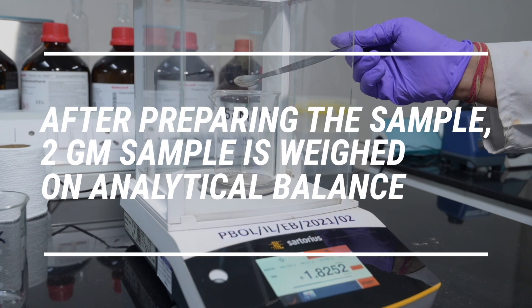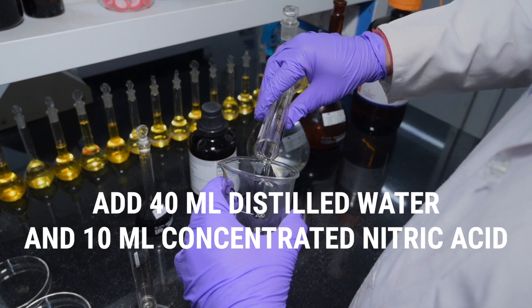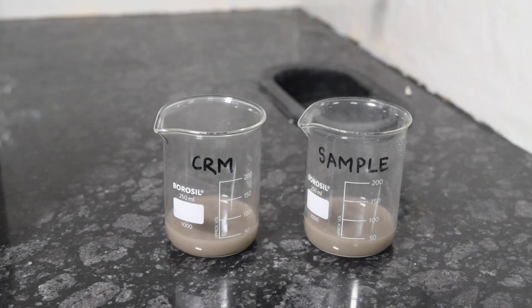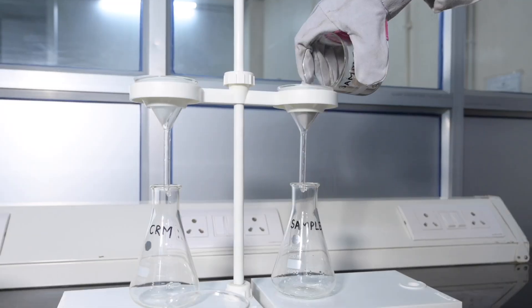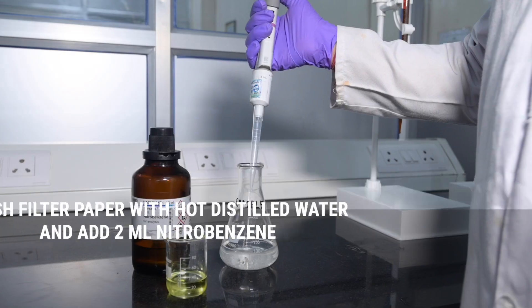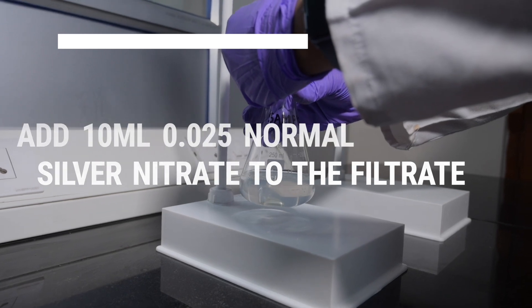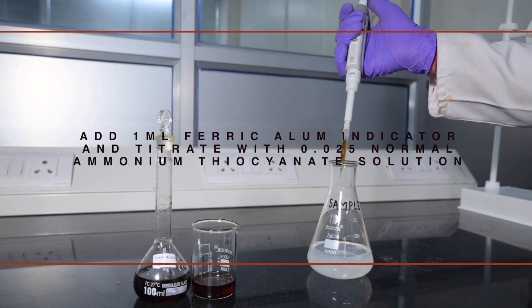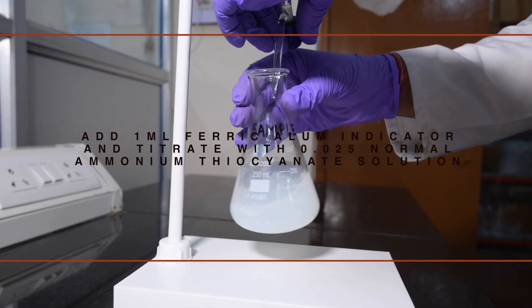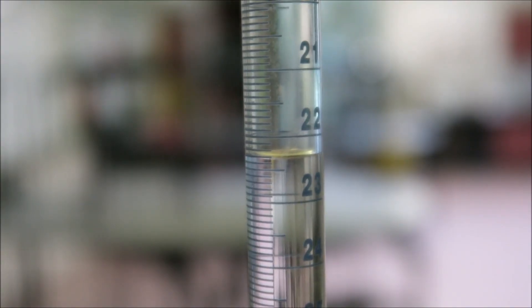After preparing the sample, 2 grams of sample is weighed on an analytical balance. Thereafter, add 40 milliliters distilled water and 10 milliliters concentrated nitric acid, and boil. Filter through the filtration assembly. Wash the filter paper with hot distilled water. Add 2 milliliters nitrobenzene and 10 milliliters 0.025 normal silver nitrate to the filtrate. Add 1 milliliter ferric alum indicator and titrate with 0.025 normal ammonium thiocyanate solution until the solution becomes a faint brown color. The final burette reading is noted.